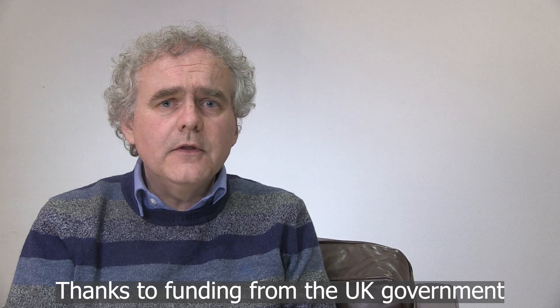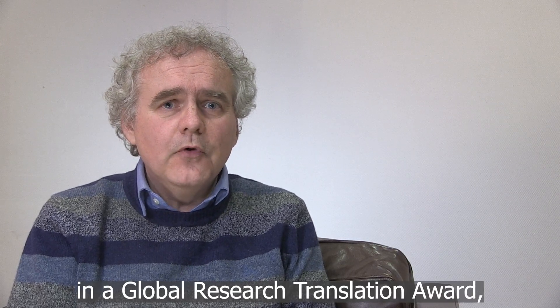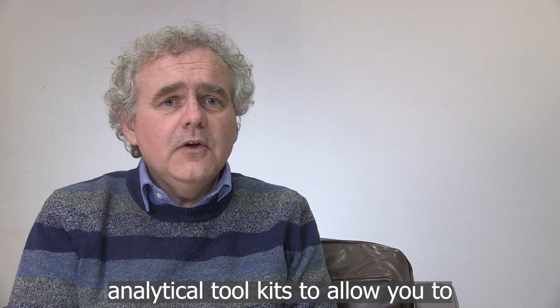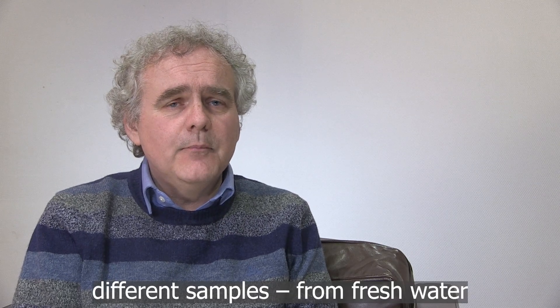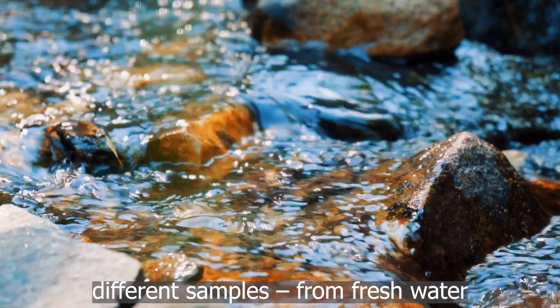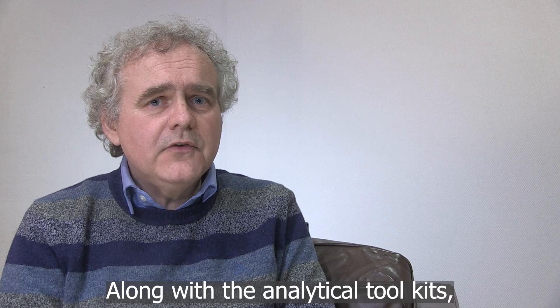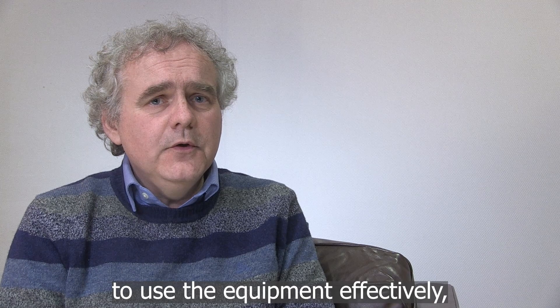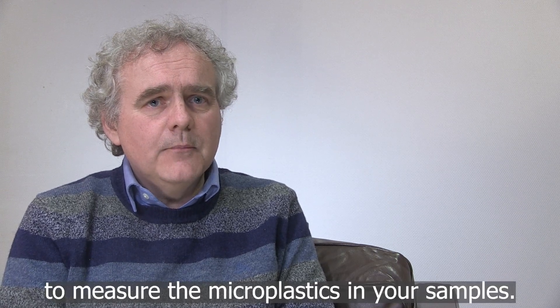Thanks to funding through the UK government in a global research translation award, we've been able to assemble some analytical toolkits to allow you to analyse microplastics in all kinds of different samples, from fresh water to marine sediments and even domestic products. Along with the analytical toolkits, we've also developed this video guide, which will help you to understand how to use the equipment effectively to measure the microplastics in your samples.